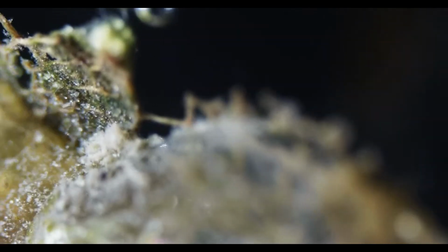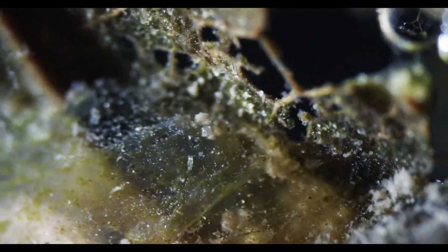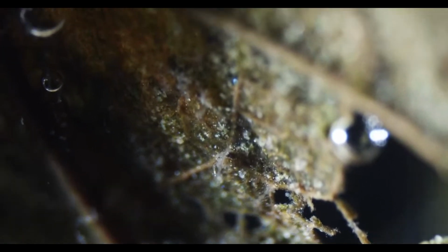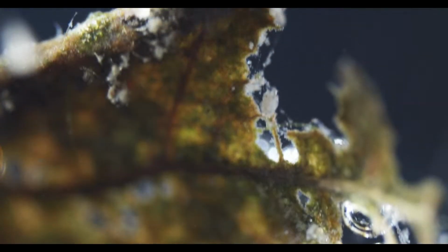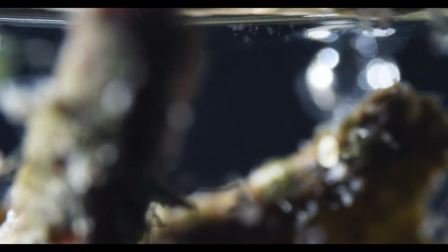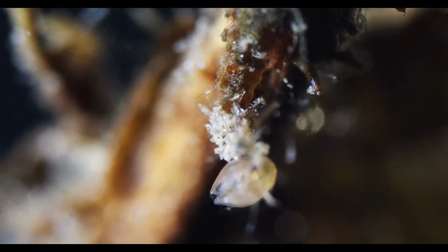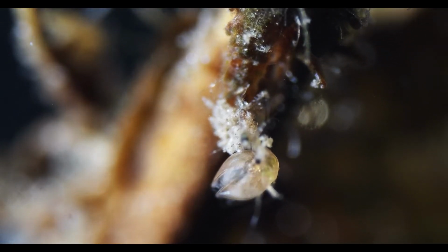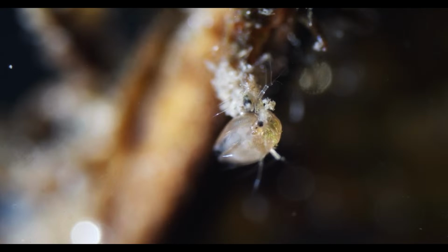So, I mean, I've been at it for an hour now. I think we might revisit the sample we looked at last time and get a better look at some of the worms in there, especially. Because I think we have seen the better part of this sample here. And yeah, the performance is kind of lacking. There's another water flea here.